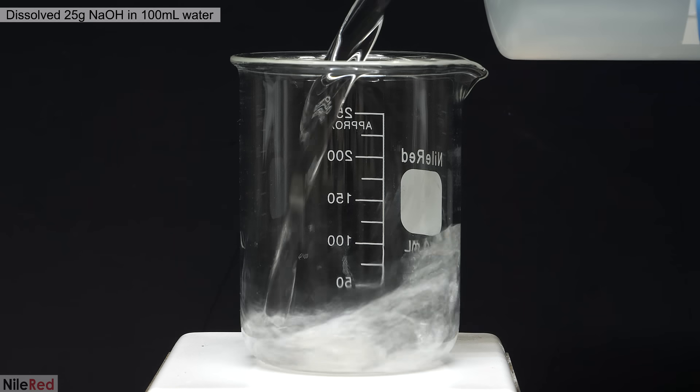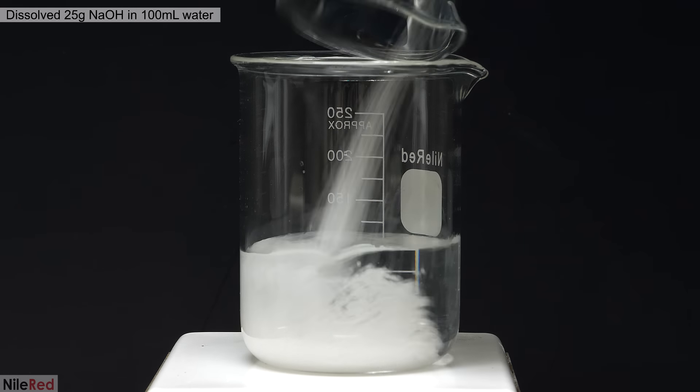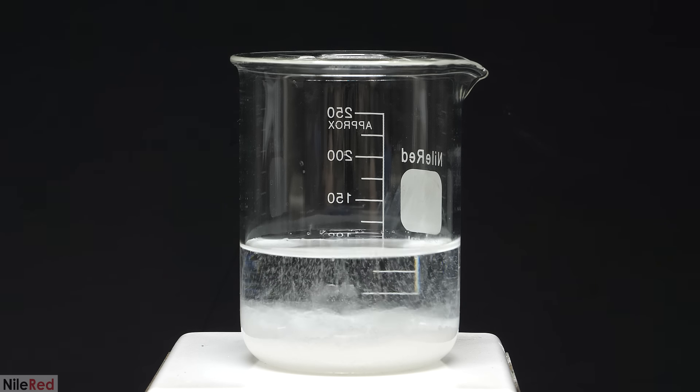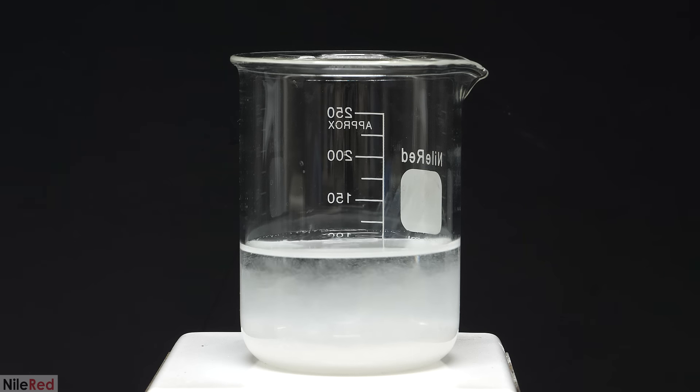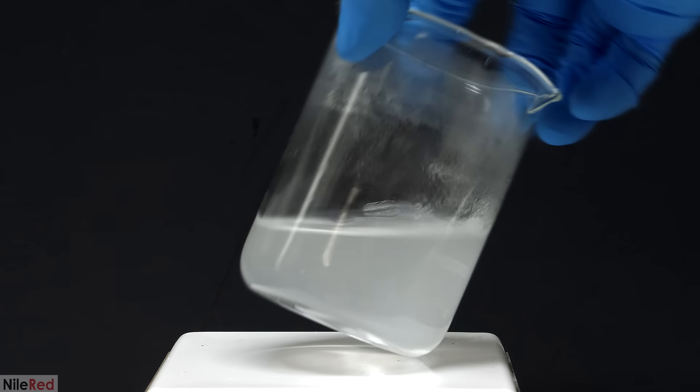The first thing that I had to do was make a strongly basic solution of sodium hydroxide. So into a beaker, I added a hundred mils of water followed by twenty five grams of the sodium hydroxide and I stirred it until everything dissolved. By the end it was still a bit cloudy, but that was just because of air bubbles.